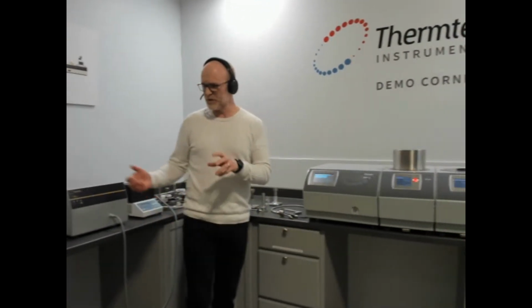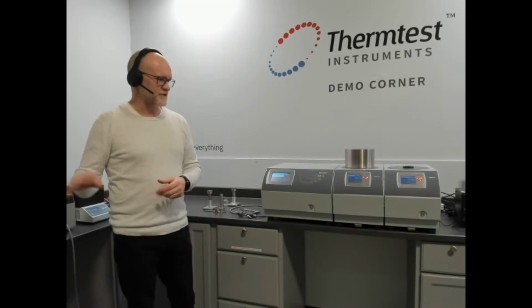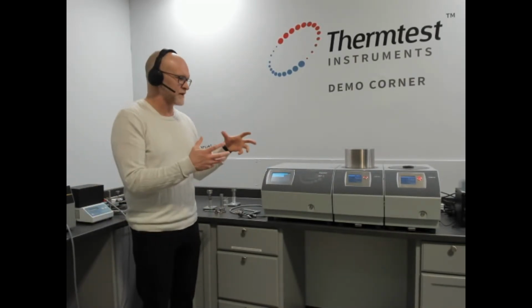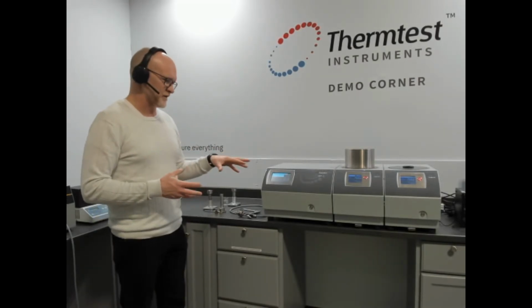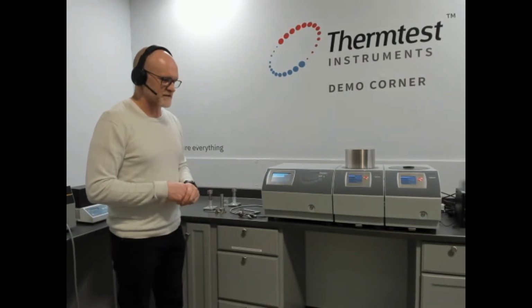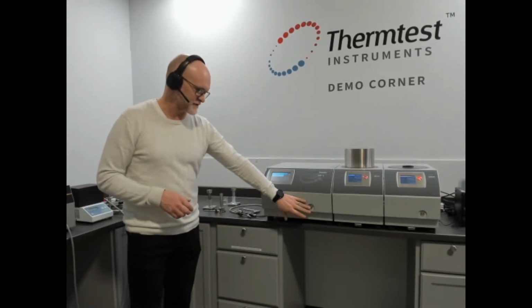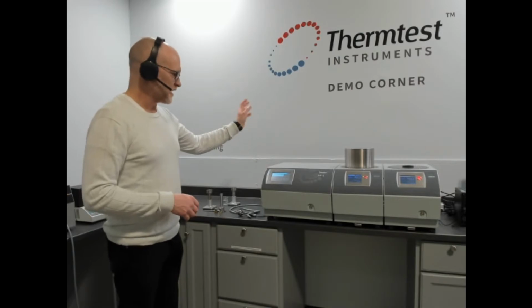So coming back to the MP-1, what we did is we brought the two instruments that I just talked about, the TPS-2 and the THW L1, into one instrument to pack a big punch. So this instrument has a lot of capabilities. The MP-1 itself has the ability to attach a sensor in the front as well as other devices.